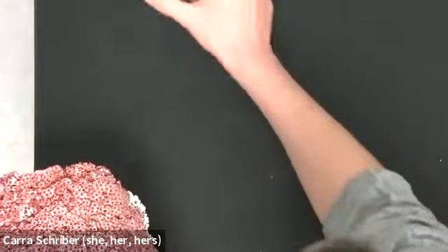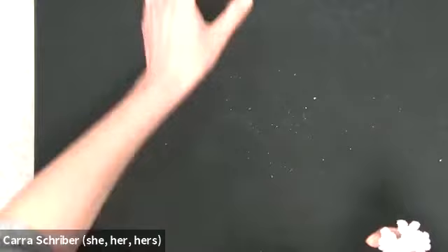So those are our cnidarian samples. So we looked at some medusa forms or jellyfish. We looked at some polyp forms. We looked at hydra, which was that singular one. And we looked at obelia, which was that colonial polyp kind of tree thing. And then we looked at some corals, not live corals, but the remnants of some coral colonies.